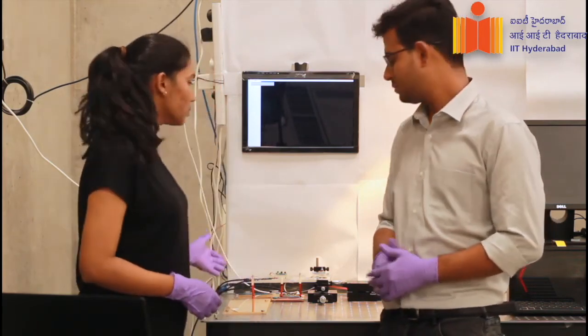We illuminate a single micro LED to perform imaging, and then the holograms of the sample are captured and applied to the algorithm to retrieve the real image of the sample. So this is how Muscope works.